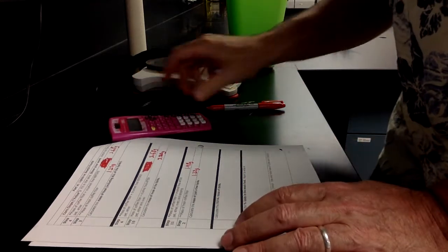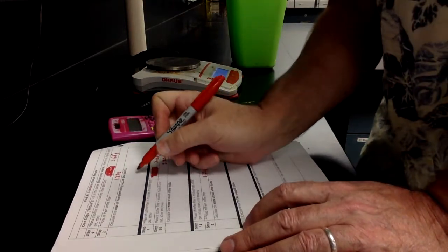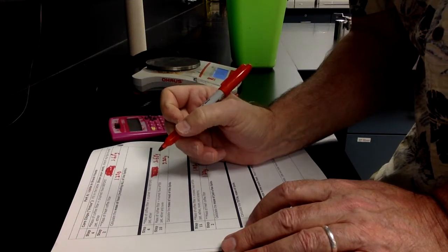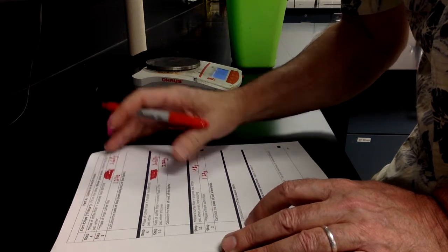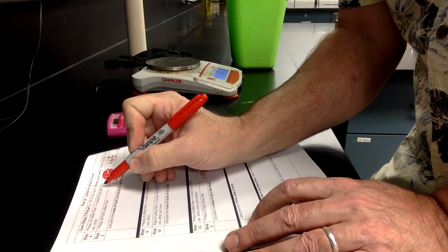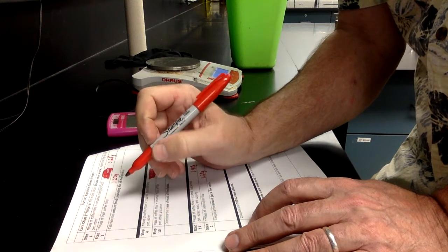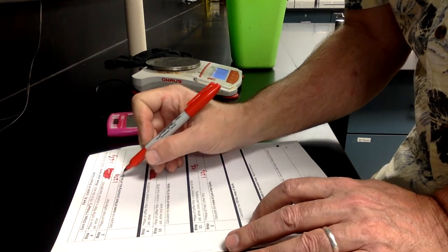So in these data tables, if you would, when you're showing work, when you're doing math, always show the work that you use to get the math figured out. So if we start up at the top for the corn chips or the Fritos, we had the mass of the coffee filter with the food in it. We hadn't put any petroleum ether on it yet, so it was before petroleum ether. We'd also written up here what the mass of the fresh coffee filter is.